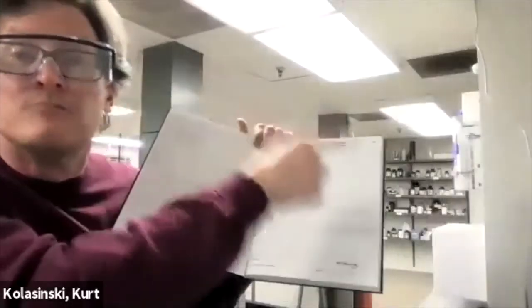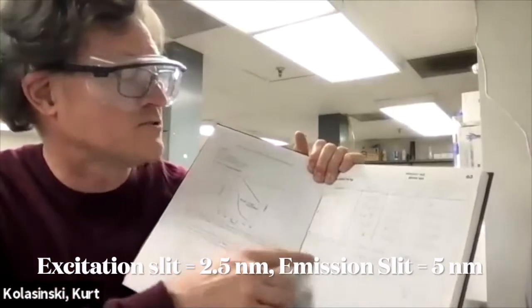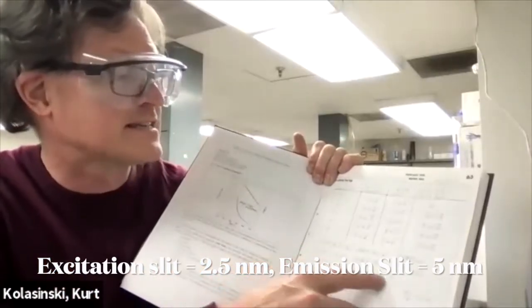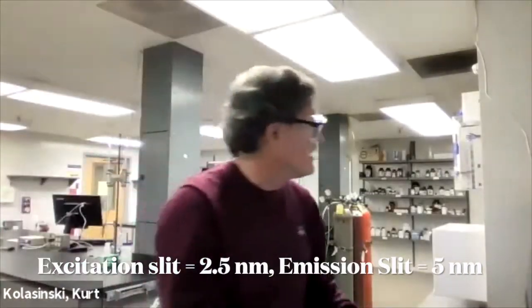Slits. We set the slits in order to get the maximum signal without saturating—2.5 nanometers on the excitation slit, 5 nanometers on the emission slit. That's good.